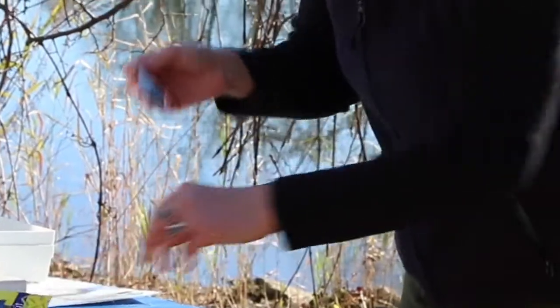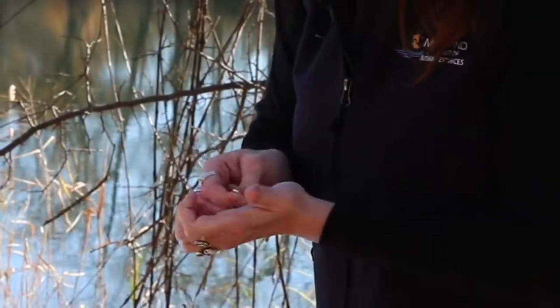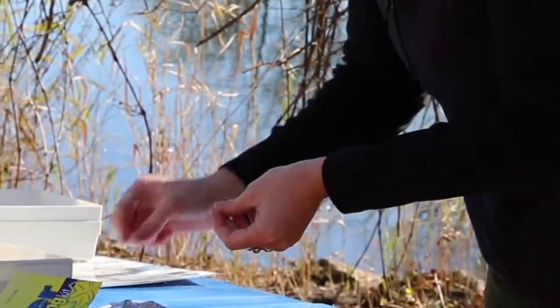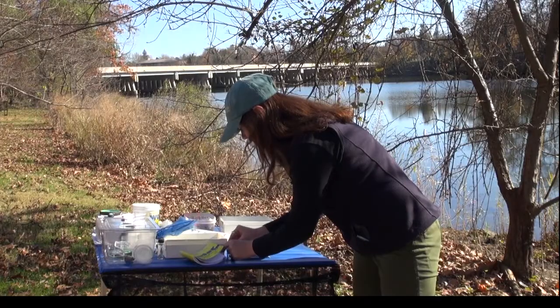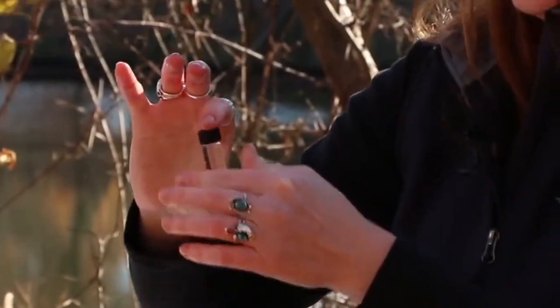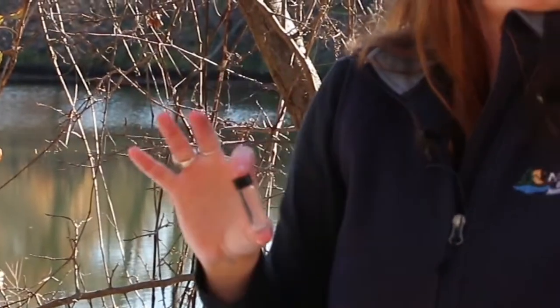I need two of the dissolved oxygen tablets for this particular kit. When you put the tablets in, it will overflow just a little bit. Then you screw the cap on tight and invert it until the tablets dissolve, and then you have to wait about four minutes.